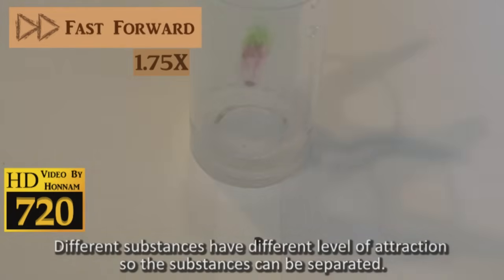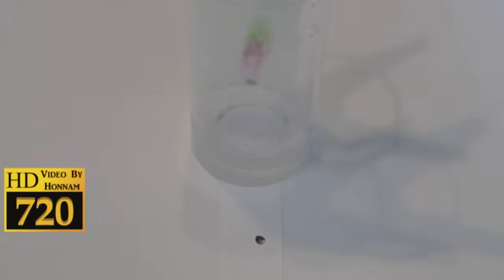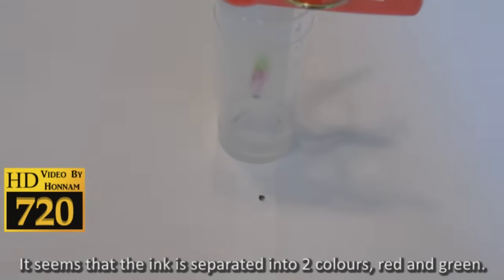It seems that the ink is separated into two colors: red and green.